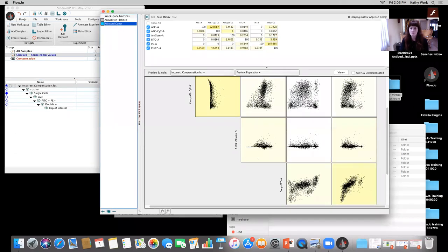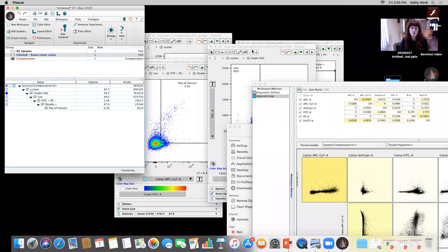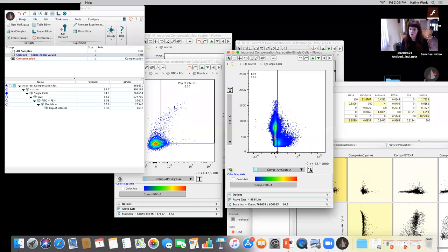When I come here, it shows a big difference in how that n by n looks. I'm going to go ahead and drag that in. Once I drag that adjusted comp that was actually carried out appropriately, all of these gates are going to have to be adjusted now, and the population percentages can actually be altered.